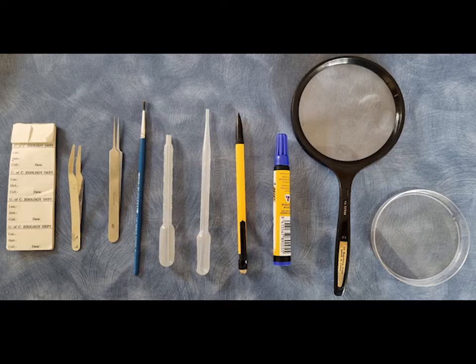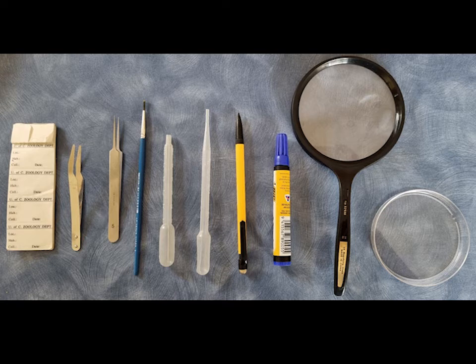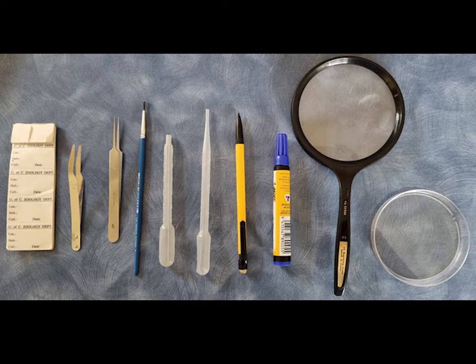When you're processing samples you're going to need a bunch of gear — forceps and those sort of things — which will make life a lot easier for you.